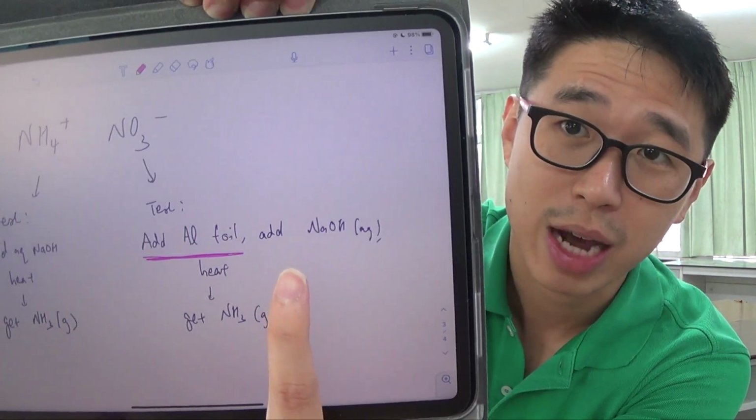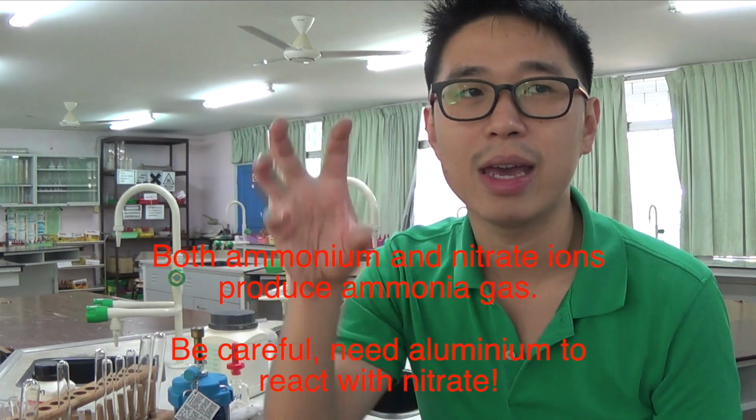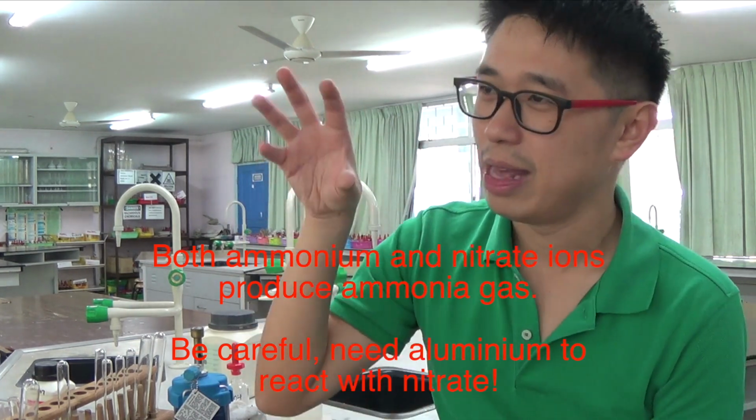So the first thing you must realize is I must not add aluminium foil first. If I add aluminium foil first, then whatever ammonia I get could be from the ammonium, because I have sodium hydroxide. Remember, you also have to add sodium hydroxide when you test for nitrate ion. So really, I should leave the aluminium foil, which is to test for nitrate, as my second step. I must test for ammonium ion first. That is the logical thing, because once I add aluminium foil, the ammonia that you get could have been from the ammonium ion, or it could have been from the nitrate ion. But you want to identify clearly that this ion is present and then that ion is present.